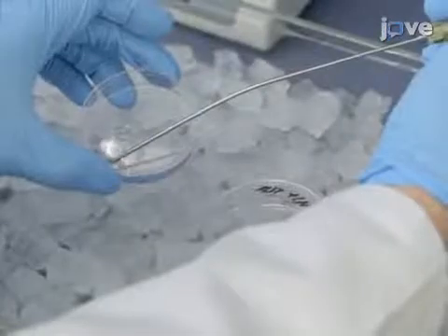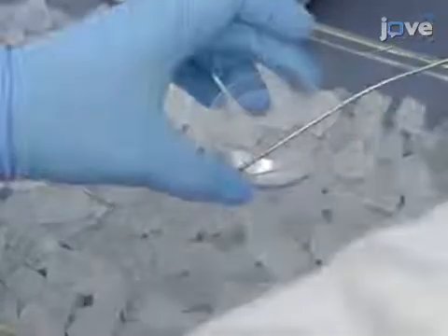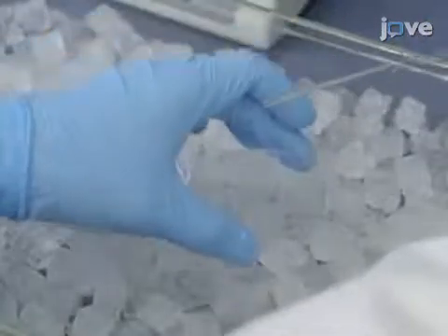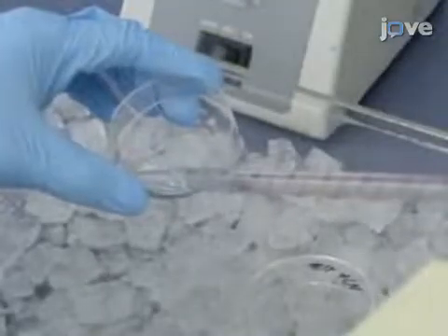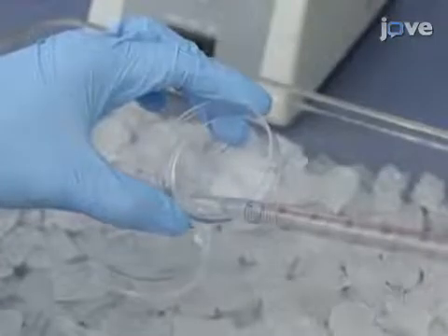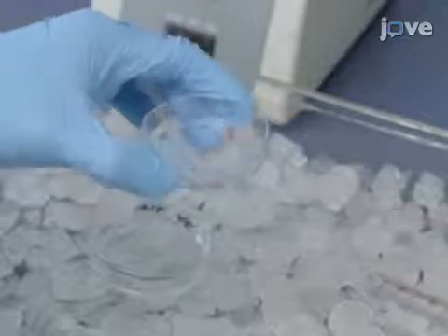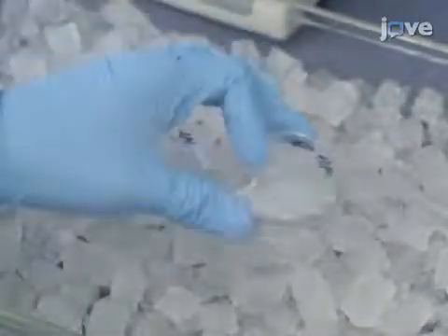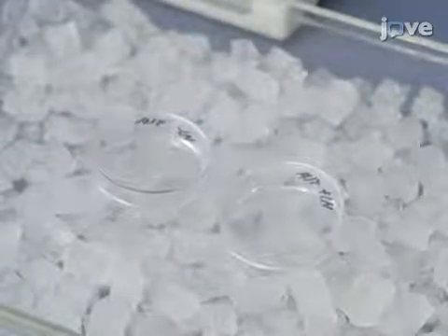Remove the CMPBS by aspiration, and then pipet 2 mL of biotin buffer into each well. Gently tilt the dishes back and forth a few times to ensure complete coverage before placing the cultures on ice for 30 minutes.